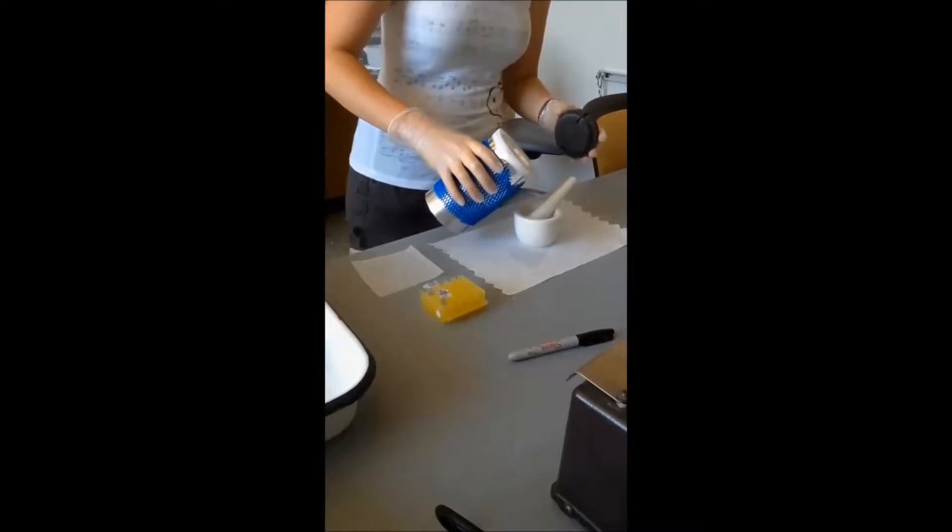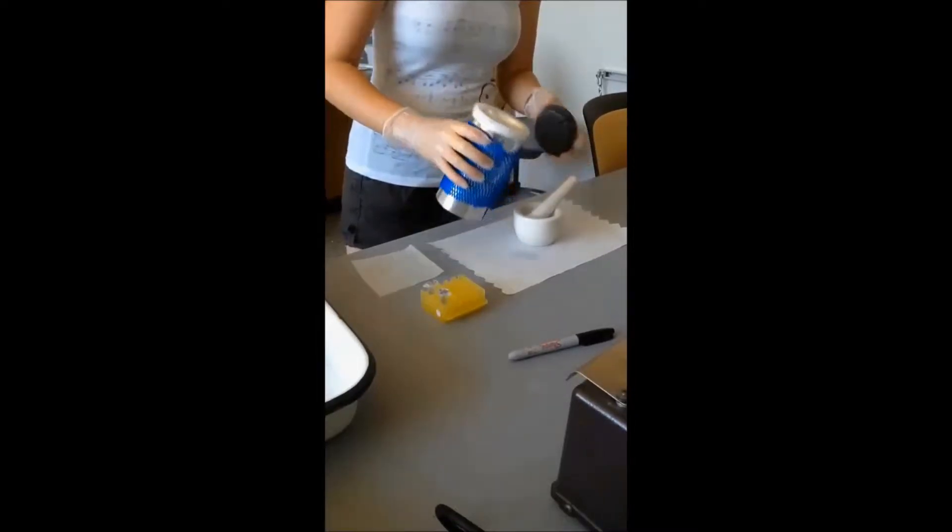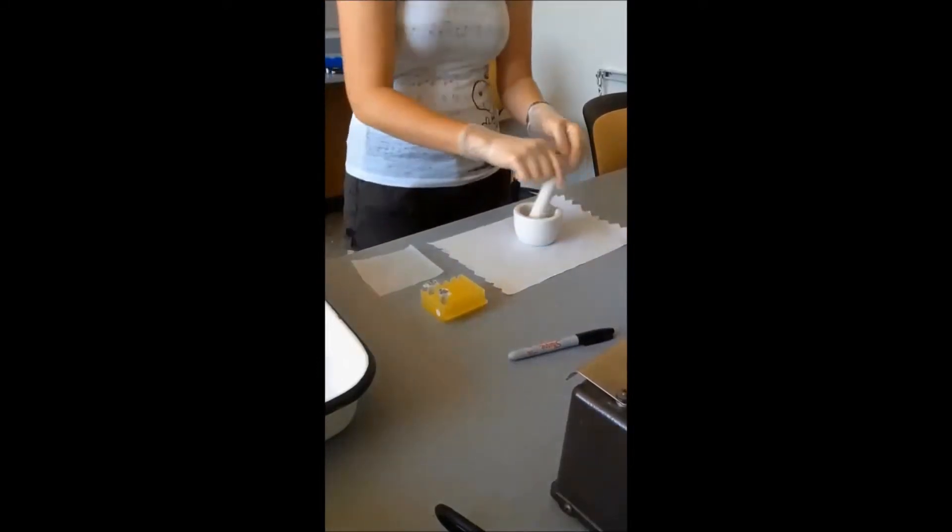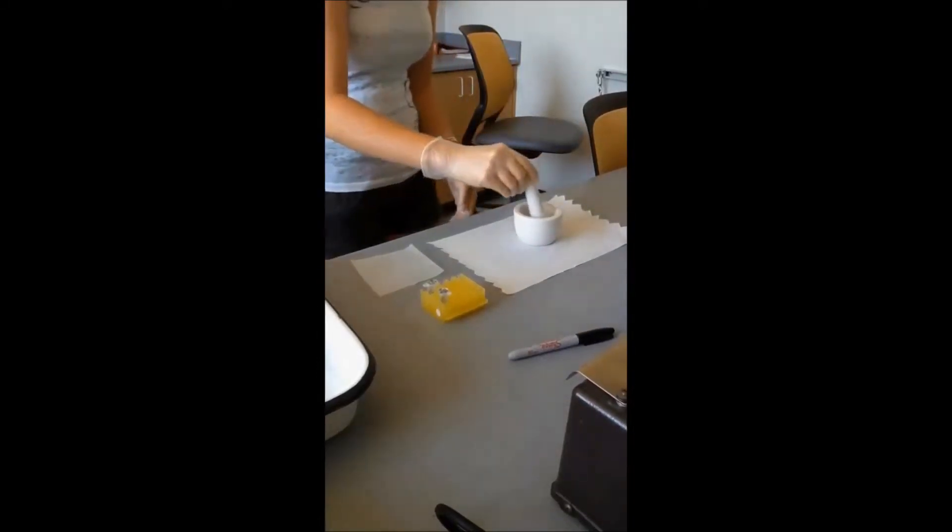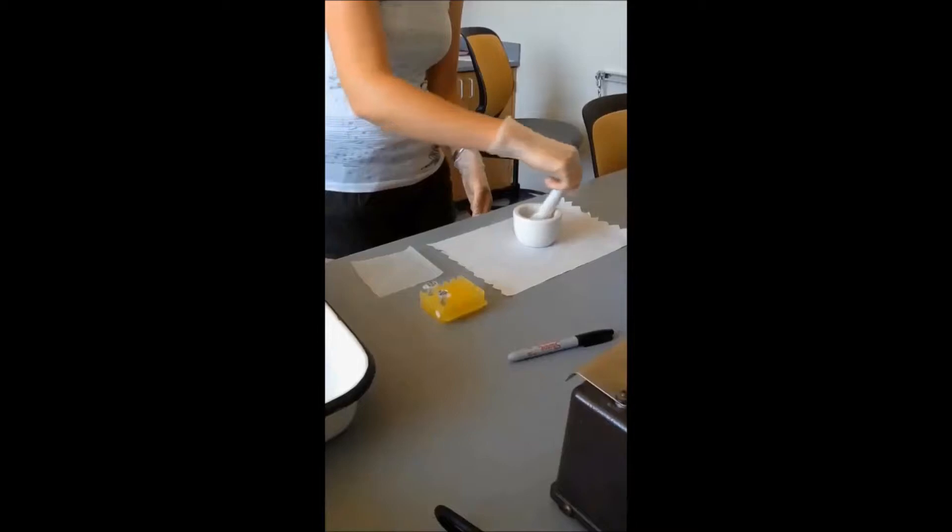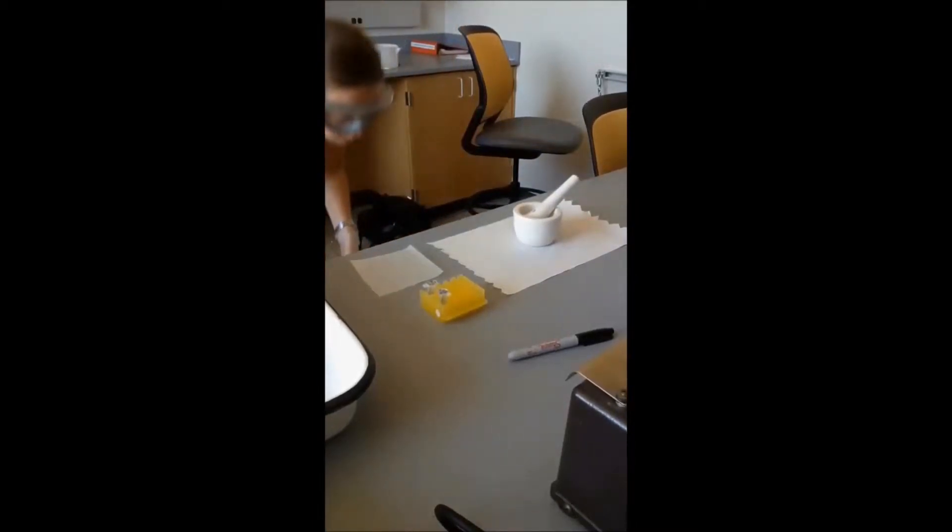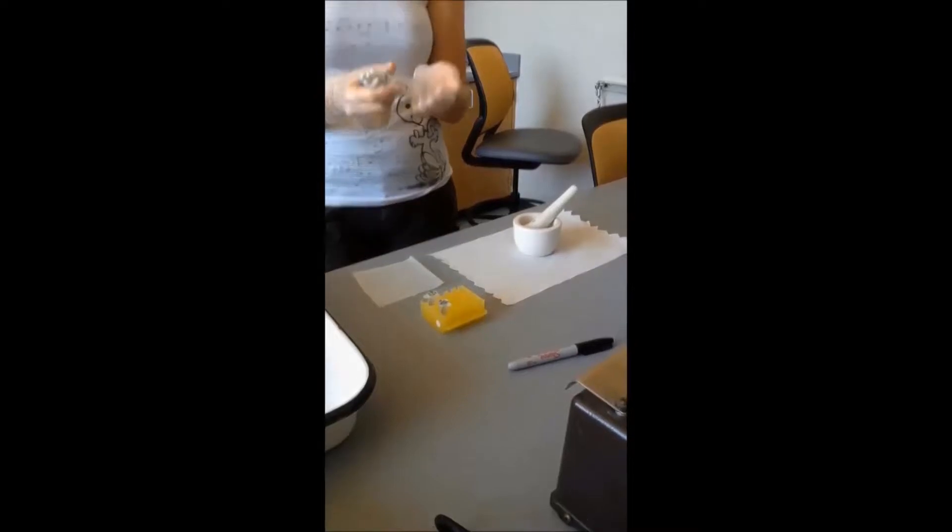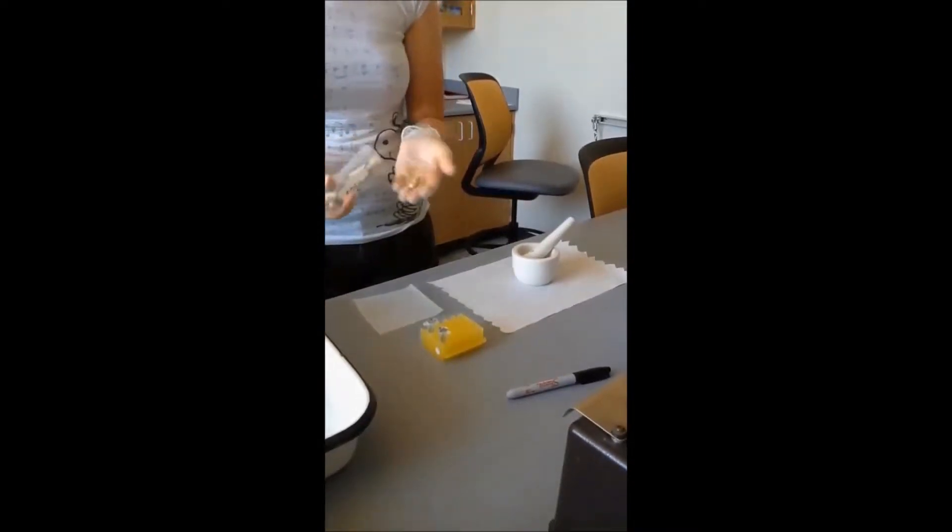So carefully adding that to the mortar and pestle, and it helps to just kind of move it around slightly. Be careful, it will splash a little. We'll be grinding two of our herbal supplements today which are just little pills.